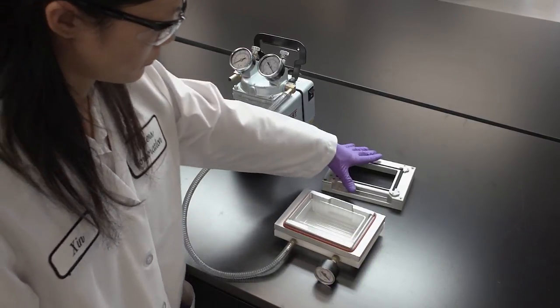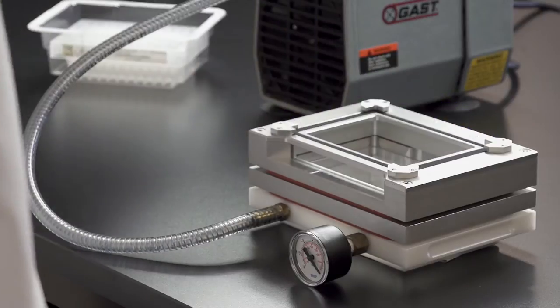If you are using a micro-elution plate, add a spacer to avoid potential plate tip contamination.